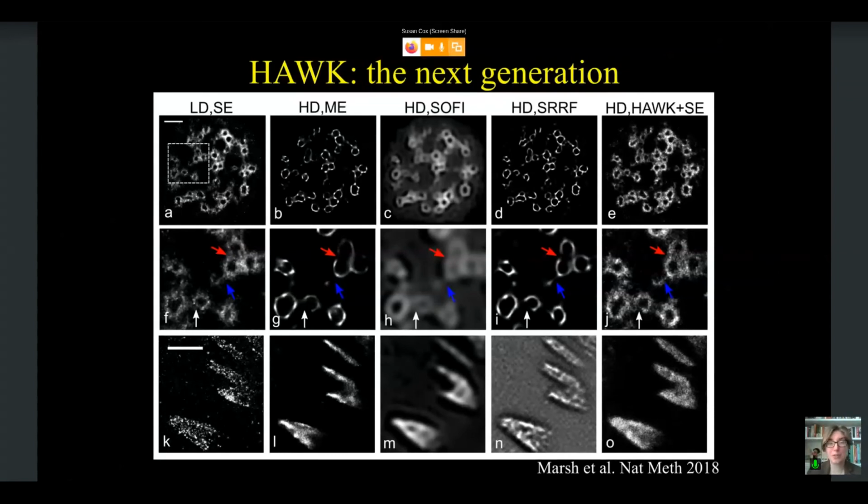Now, of course, they were acquired over somewhat different timescales. It's not absolutely identical, but it is very similar. With the focal adhesions, we were able to acquire a lot more fluorophores, so we do have an image that's filled in over a wider area, but the structures are almost identical visually.